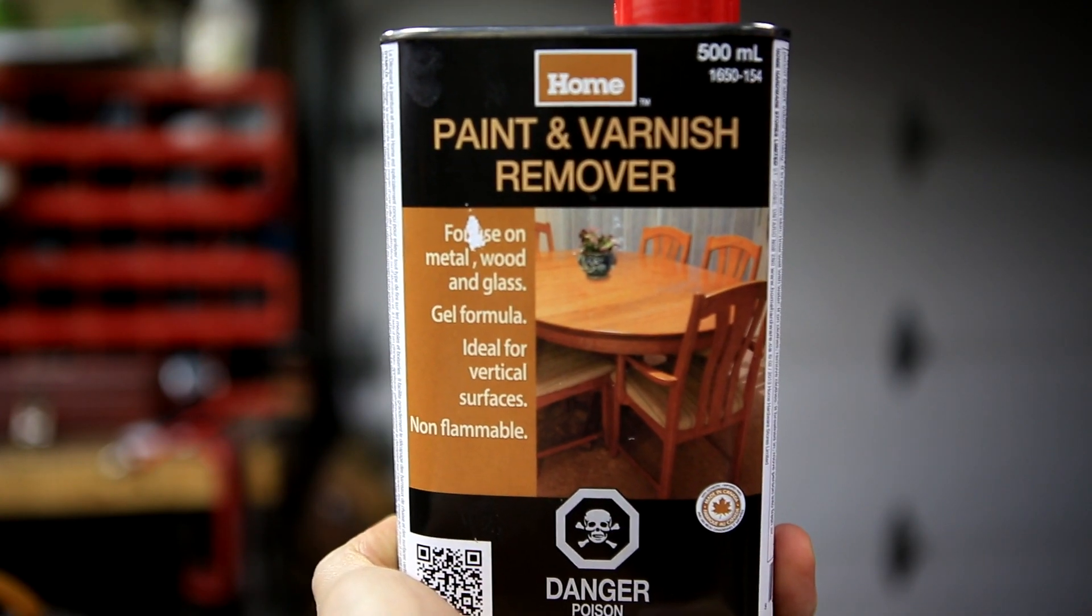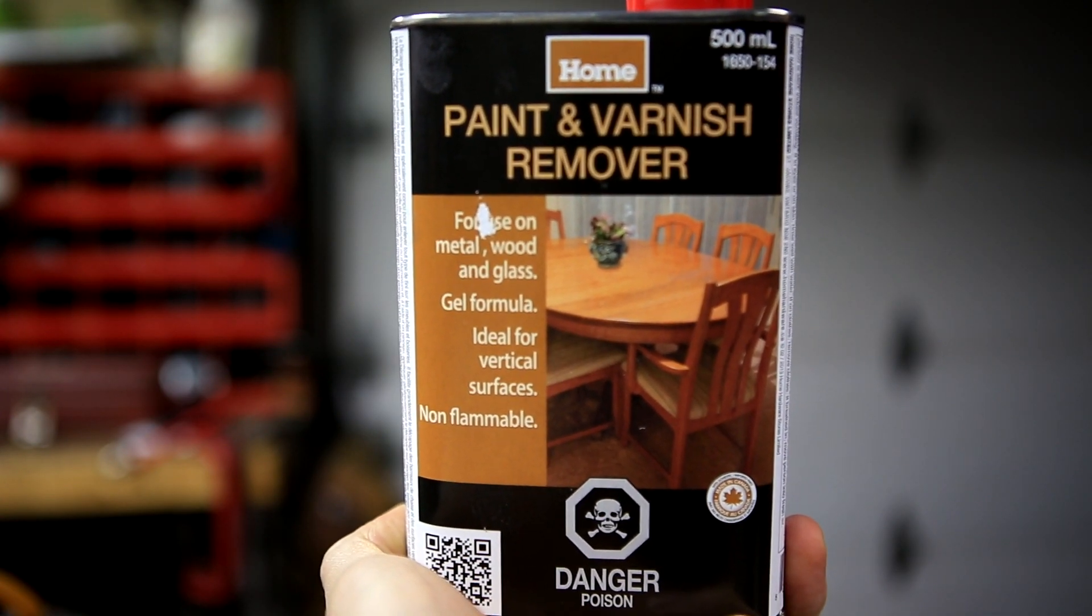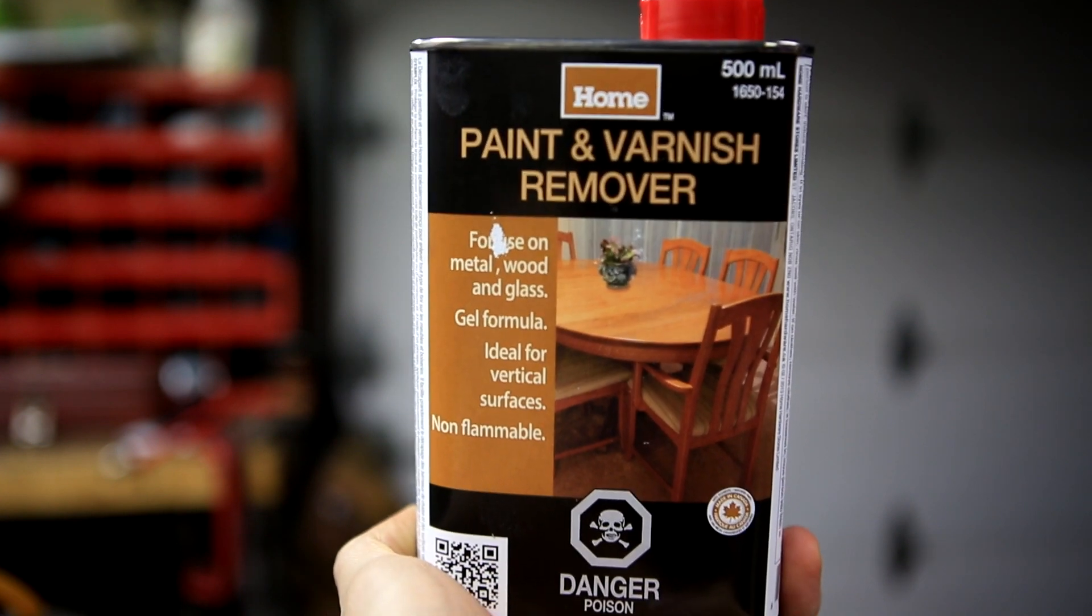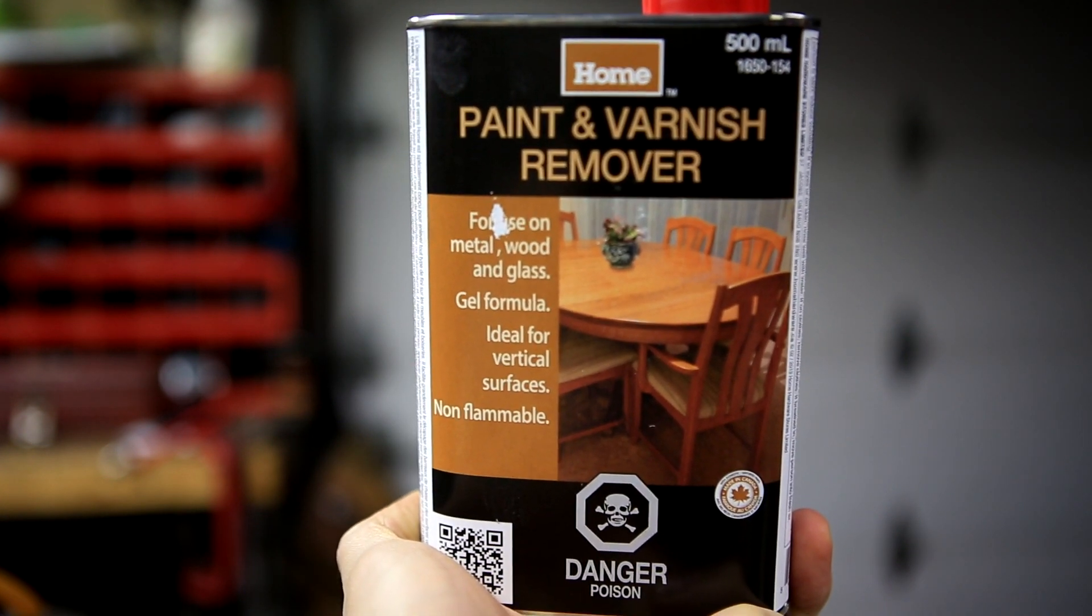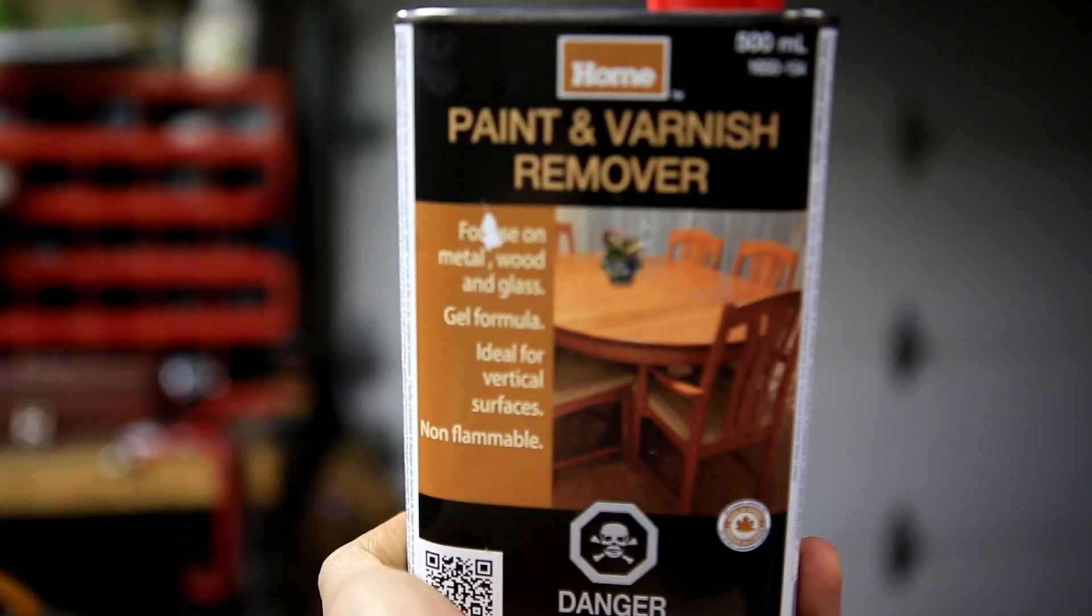I used Home Hardware brand paint and varnish remover that said that it contained methylene chloride on the side. Most methylene chloride containing strippers are going to be in a gel formula.